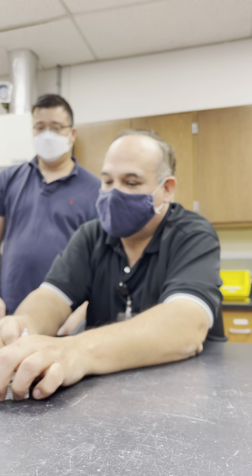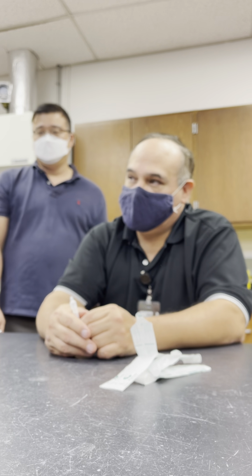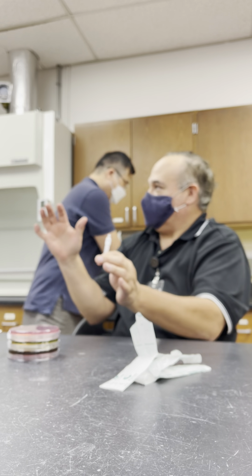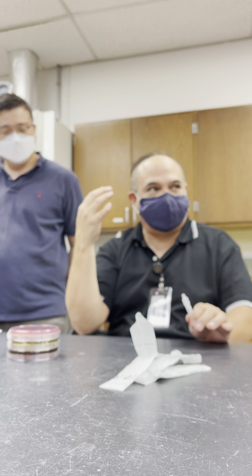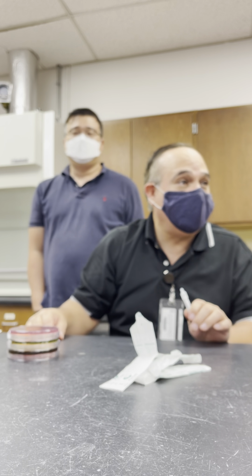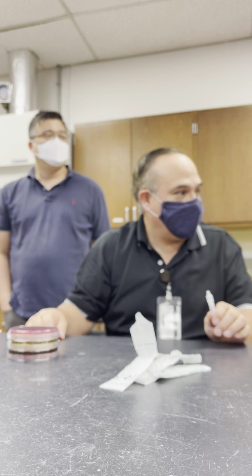And I'll recycle those. Okay, so, Cheska, will you do a 4-quadrant streak of E. coli on EMB? So we all don't do it? No, hold on. This is extra. Everybody's going to do normal stuff, but I'm going to pick a few people to do an extra so that we can see E. coli all by itself. Okay? So, Jaylin, will you do Salmonella on Hektoen enteric agar? Yes. 4-quadrant streak? Yes. And Tamisha, will you do E. coli on MacConkey?